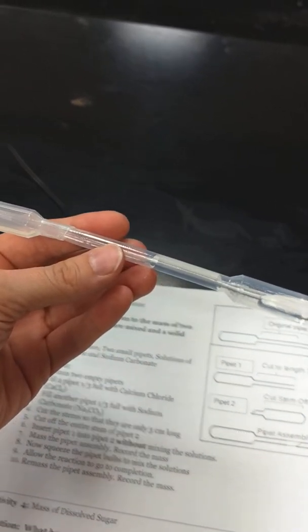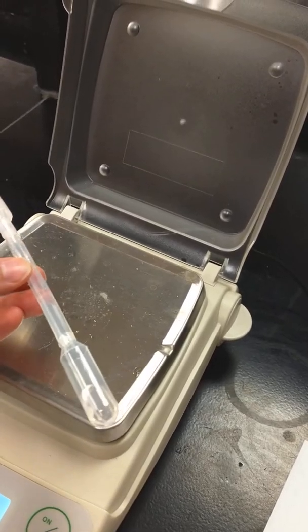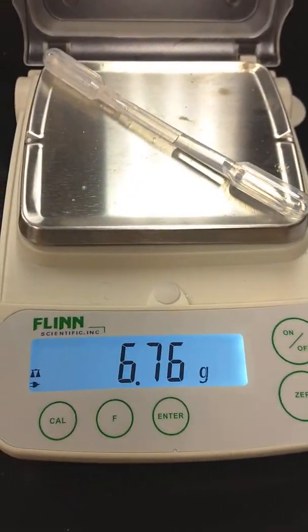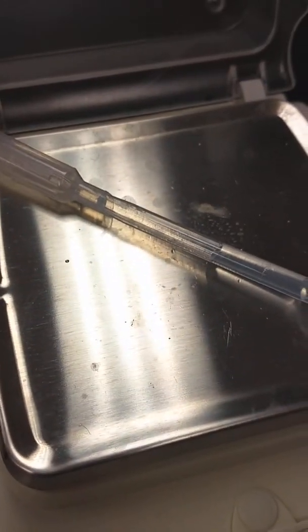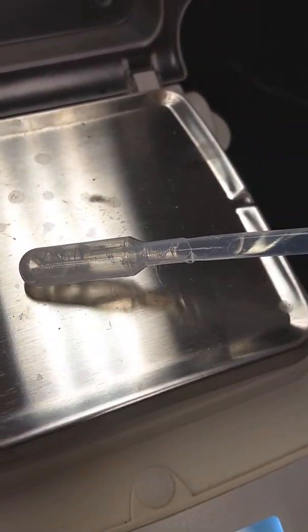It asks you to cut them so that one fits inside the other. I've tried not to mix them. I'm going to put these on the scale and see what it gets me. This is before the liquids were reacted, so record that. Now I'm going to mix them — I'm going to squeeze one into the other.